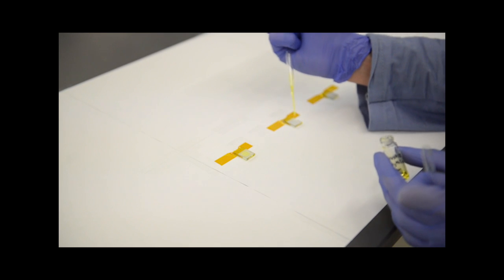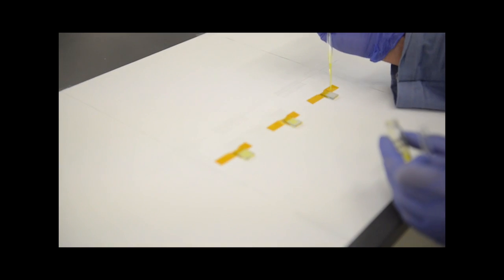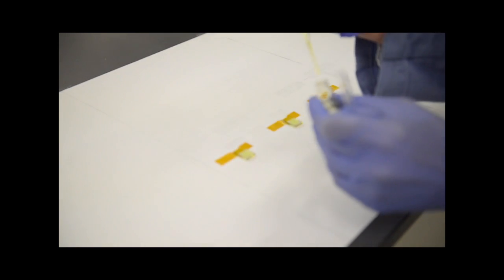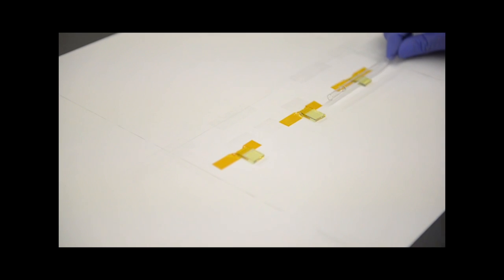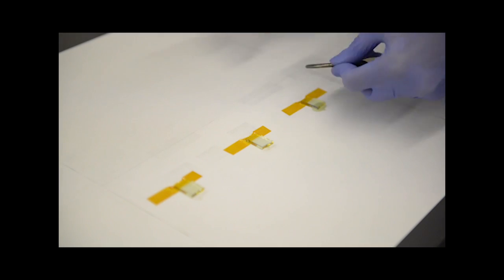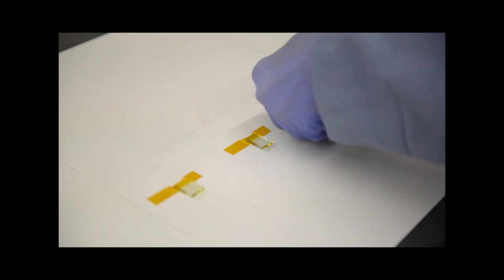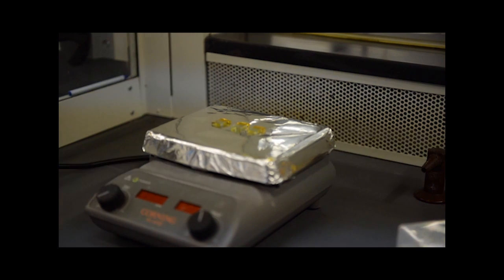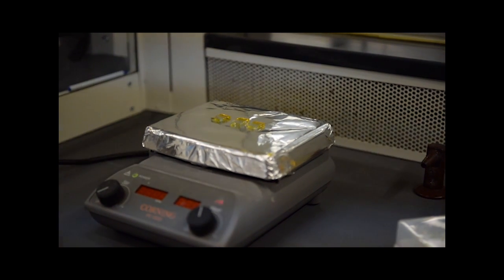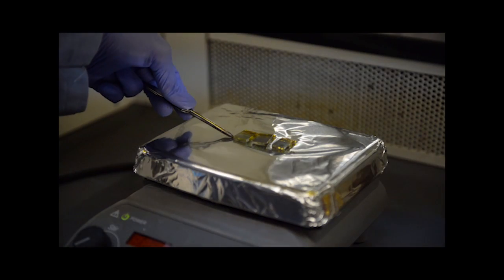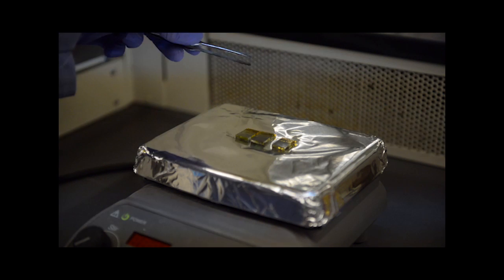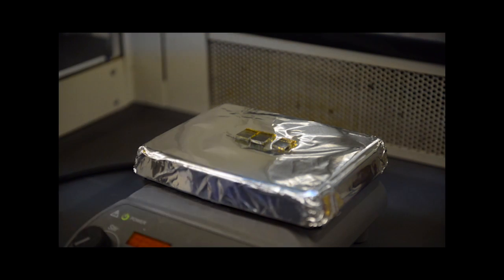We put one drop of perovskite solution and spread it across the surface with a pipette. We roll the pipette over the glass several times to create a uniform smooth film. We keep the uncoated surface covered and remove the excess tape. We place the glass piece on a hot plate preheated to about 110 degrees celsius. We wait until the film turns completely black and let it sit there for another 10 minutes.